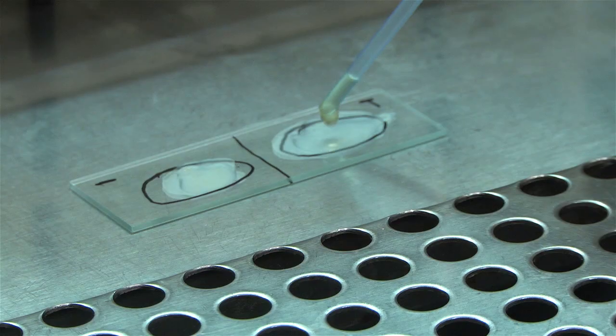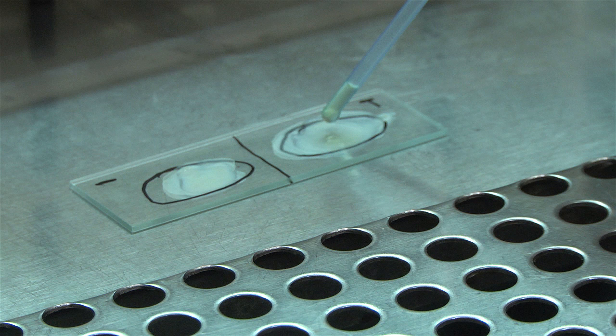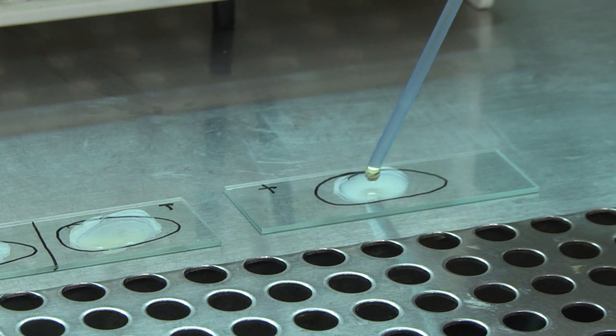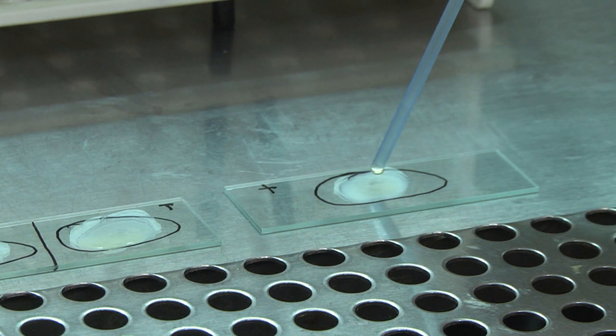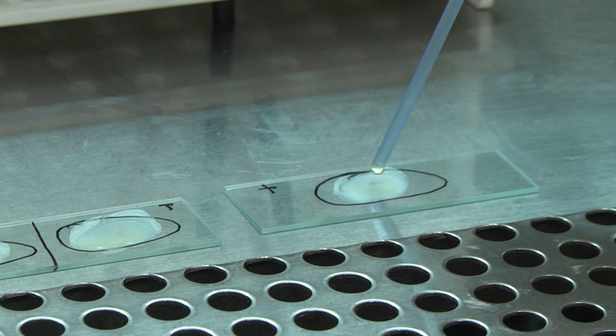Place a drop of rabbit or human plasma on only one section of the test slide. Similarly, place a drop of plasma on the positive control slide. Gently rock the slides to and fro.